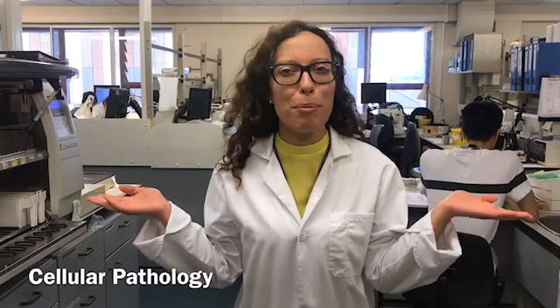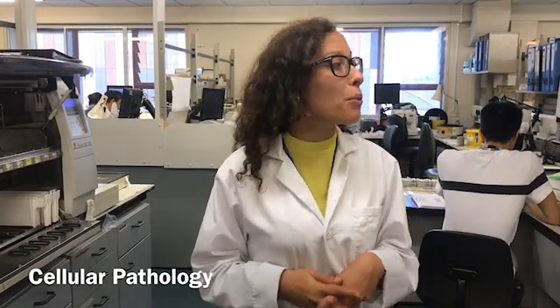Hello, my name is Sarah Fernandes and I am a biomedical scientist at the Cellular Pathology Department at Royal Bournemouth Hospital. In the histology department we receive all kinds of histology samples — body tissue samples — and we process them. The end result is the tissue on a slide that can then be visualised by the pathologists under the microscope, and they can assess the slides and look for cancer and other kinds of diseases. Our tissue samples are received in the cut-up room where the pathologist will dissect them into a representative tissue that they want to look at under the microscope. After those sections are taken, they have to be processed until the final result is obtained, which is the tissue on a glass slide.